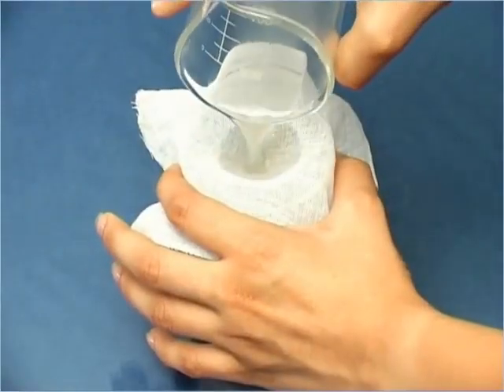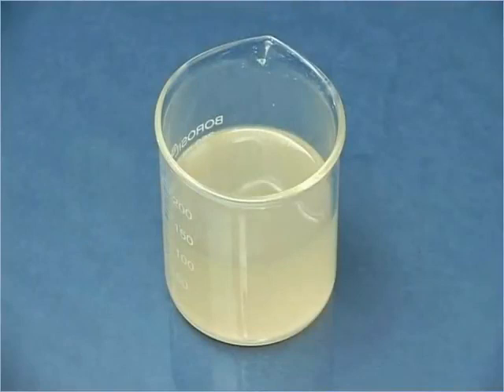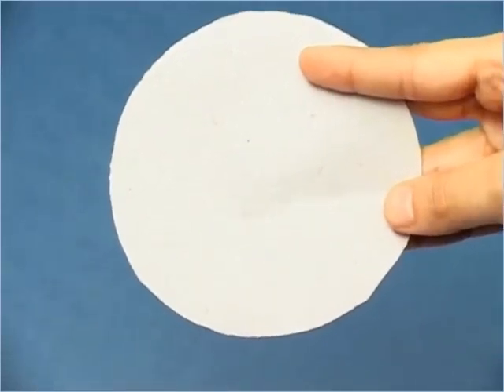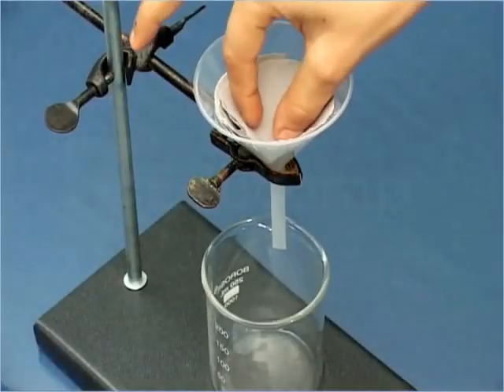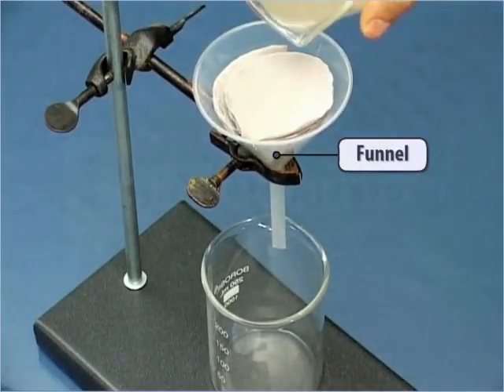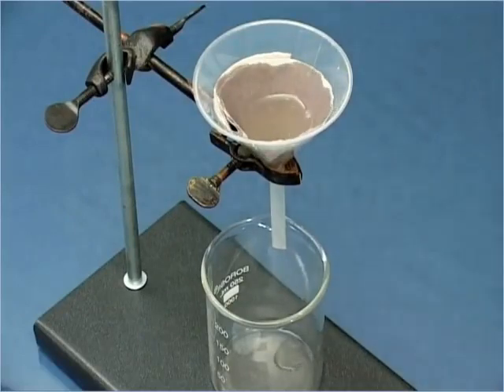Some mud has deposited on the cloth, but the water obtained after filtration still contains mud. We need a filter paper, which can separate the fine particles of mud from the water. A filter paper has smaller pores than cloth and hence can be used for this purpose. Place the filter paper in the funnel and pour the water obtained after filtration with cloth.